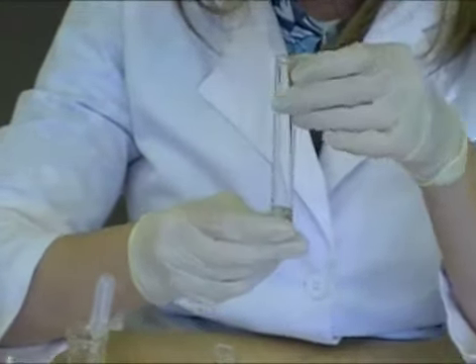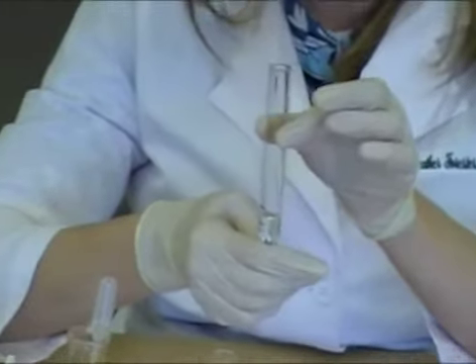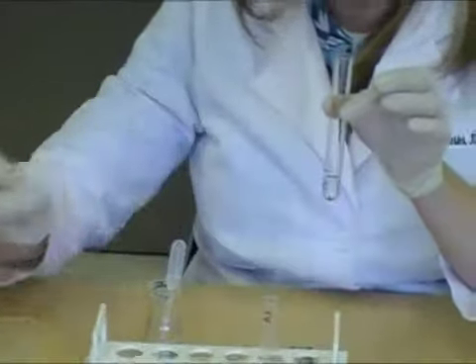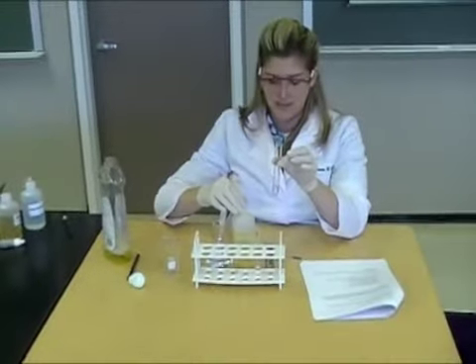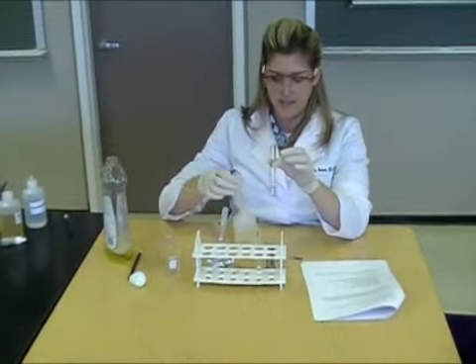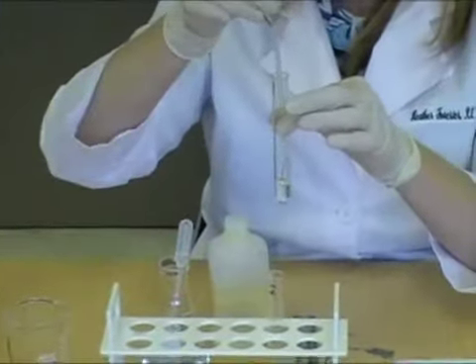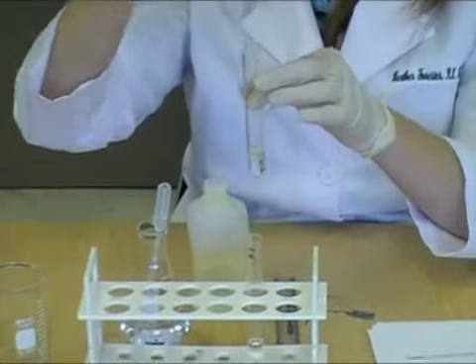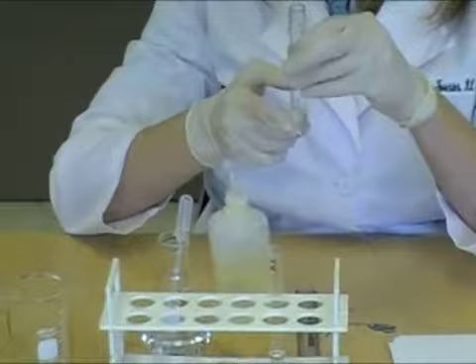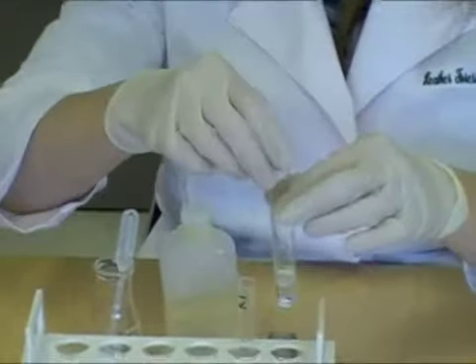Add water to test tube 1 to the 1 cm mark. Then add oil—vegetable oil from your cabinets is perfectly fine. Use a disposable pipette or pour it into your test tube until it reaches the 2 cm line. Swirl and observe your results.